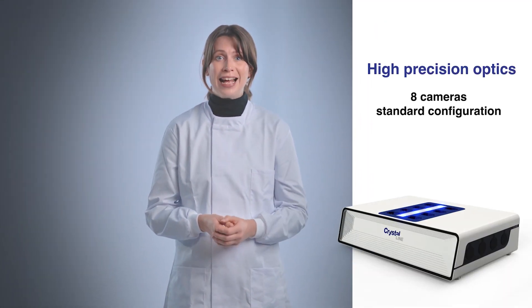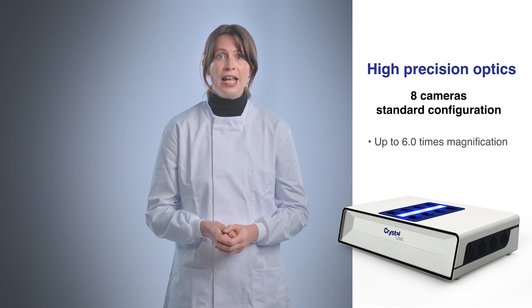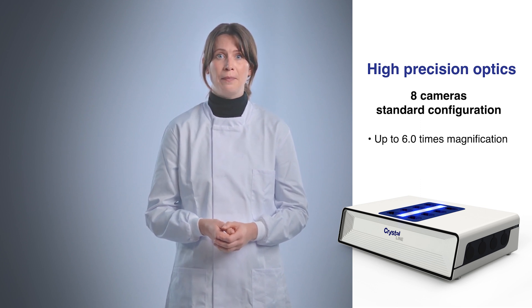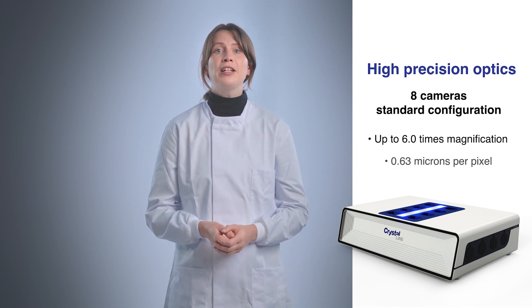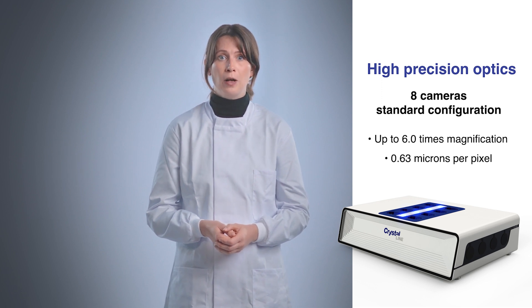The instrument comes with eight cameras positioned in a standard configuration, capable of up to six times magnification. A resolution of 0.63 microns per pixel can be reached without any problems, making information close to nano scale easily available while you are performing your experiments.